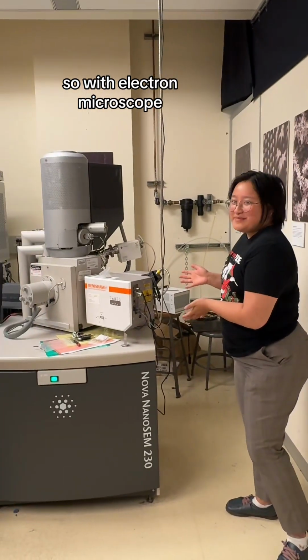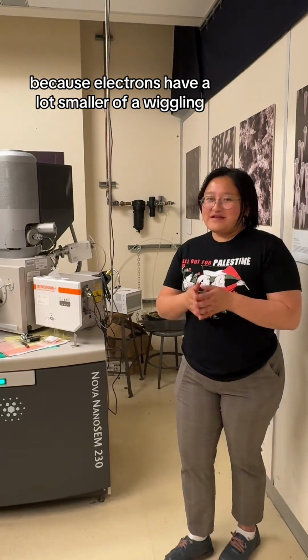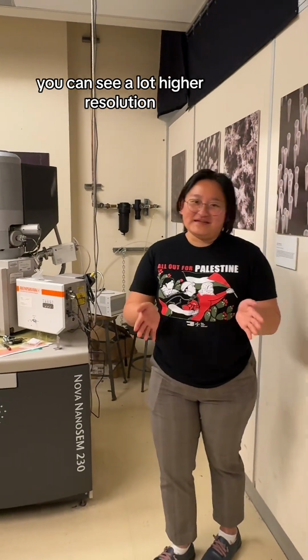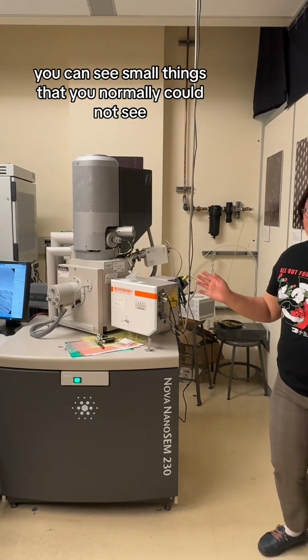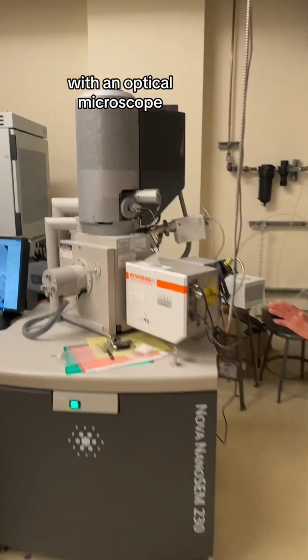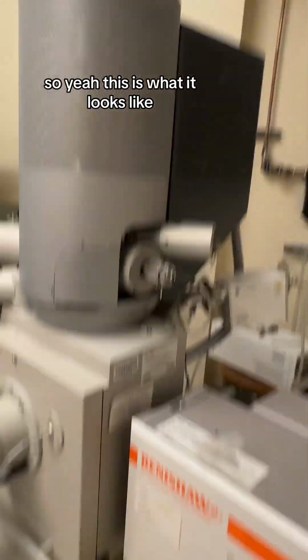So with an electron microscope, we use electrons to look at samples, and because electrons have a much smaller wavelength, you can see a lot higher resolution. So you can see small things that you normally cannot see even with an optical microscope. So yeah, this is what it looks like.